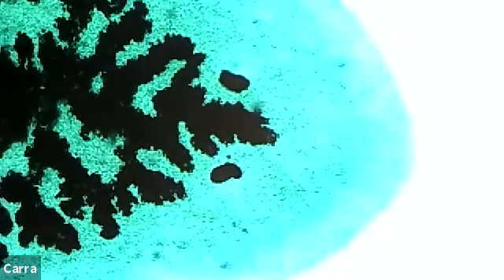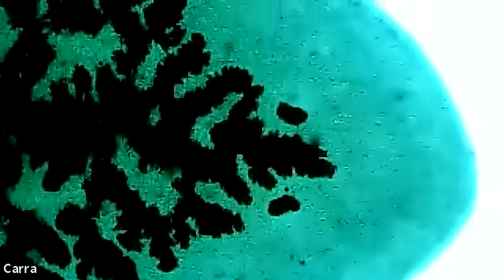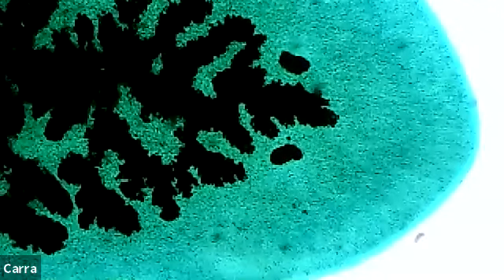And flatworms, you can see what we're looking at right here is the head portion. And I know that because do you see the two spots at the very front of this organism's head? Those are actually eye spots. So, and if we looked at the tail, let's just look at the tail for contrast here. So if we looked at the tail, we can see that it does not have eye spots. So that's the tail. I know that because it does not have eye spots. And then we do have a tail here, all right?